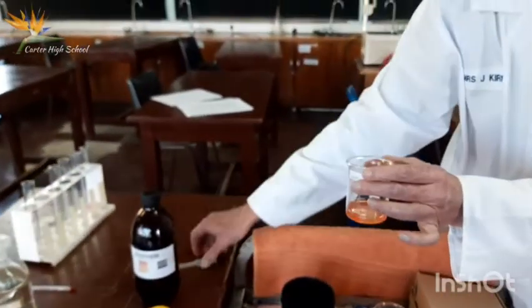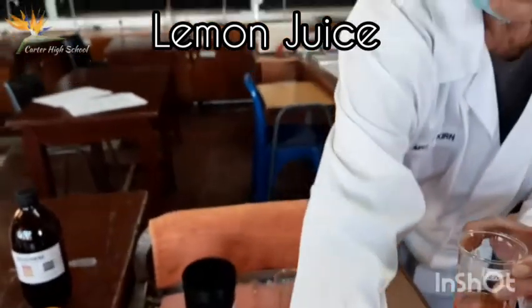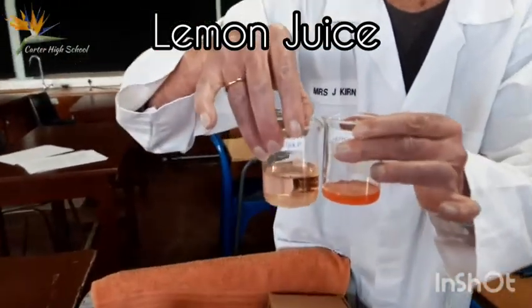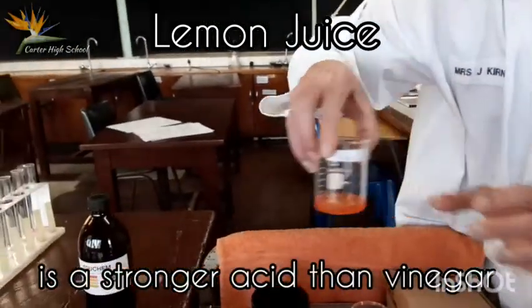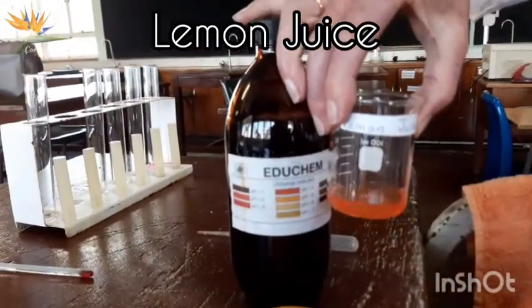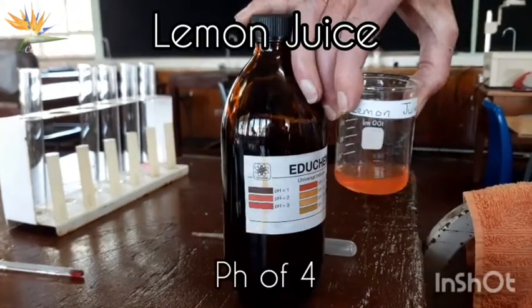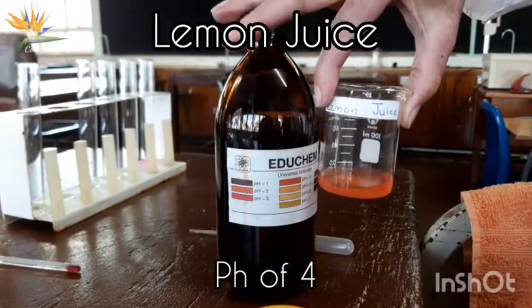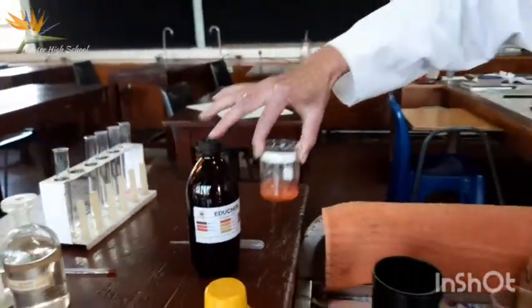Moving on to the lemon juice. You compare the lemon juice to the vinegar, you can see that the lemon juice is a slightly darker color than the vinegar, indicating that it's a stronger acid than the vinegar. And let's have a look at the value. Right, quite strong. Pretty much 4, around about 4. Okay, do you think it's darker than that? No, I'd say pH of 4. It's probably the closest color reading we can take for that. Okay.